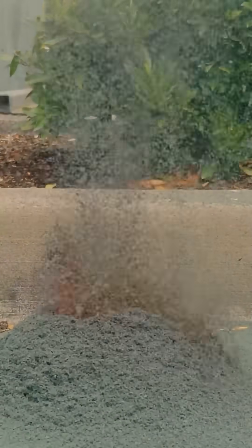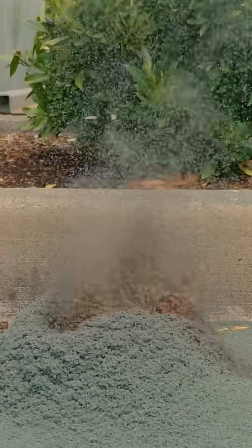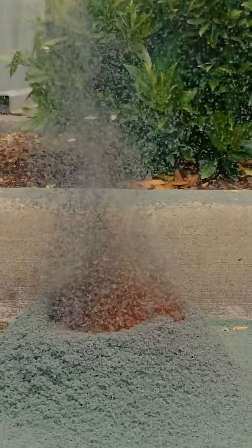But the best part about this reaction is because it's thermally decomposing, it means that it doesn't need oxygen to burn. So even though it gets covered with this green chromium oxide, it can continue to decompose and burn underneath, and it keeps throwing up the nitrogen and water vapor.